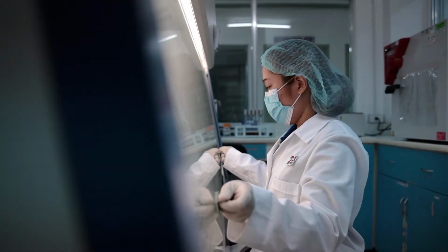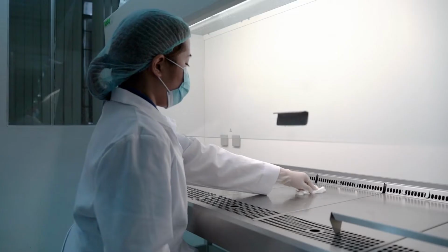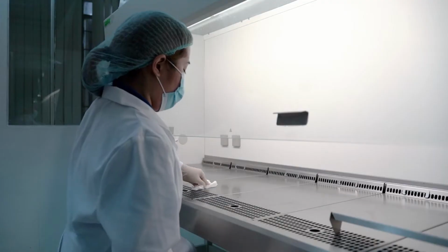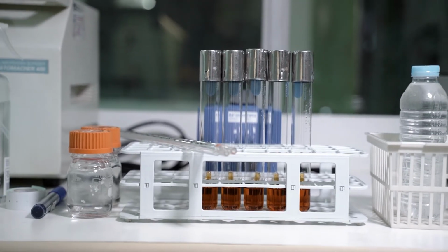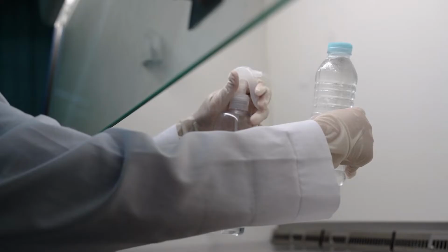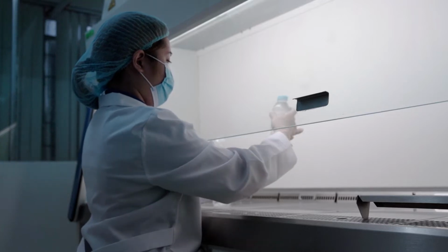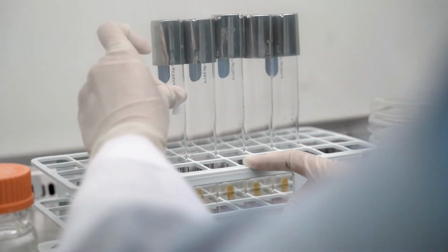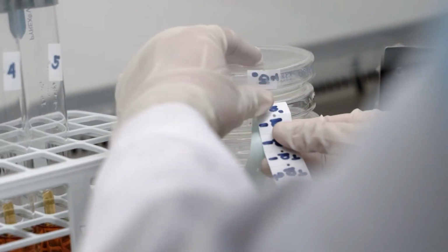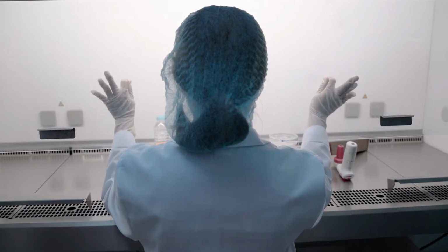First of all, we should clean the surface of our working area with a suitable disinfectant to ensure that there will be no contamination during our test. Then, we will proceed to our first procedure, which is the sample preparation. We need to disinfect the sample packaging or container with a suitable disinfectant prior to analysis. After that, we will clearly mark each culture media tube, plate, and dilution water with the sample laboratory code and any other necessary information before examination. So now, we're all set for testing.